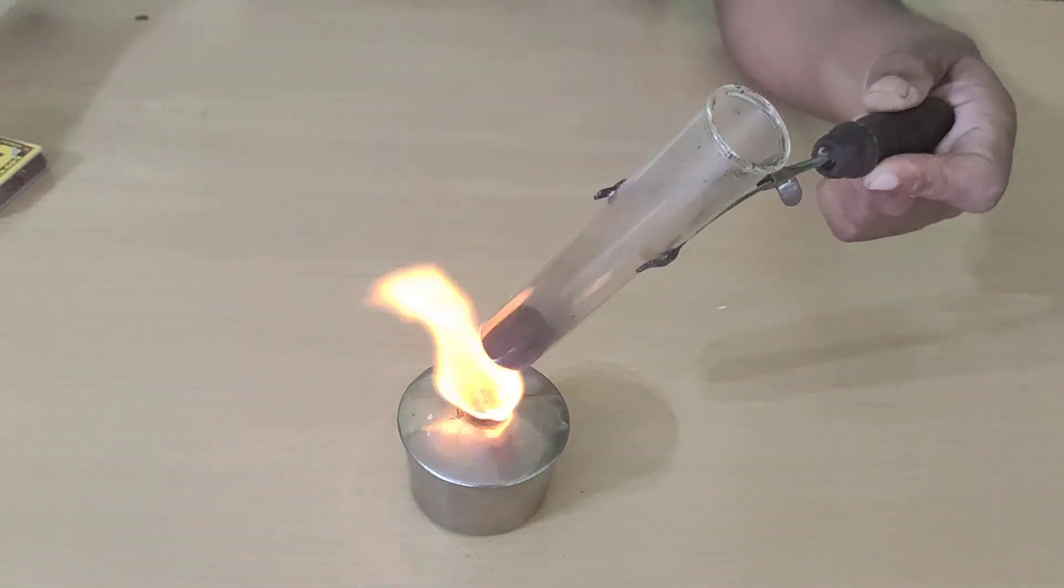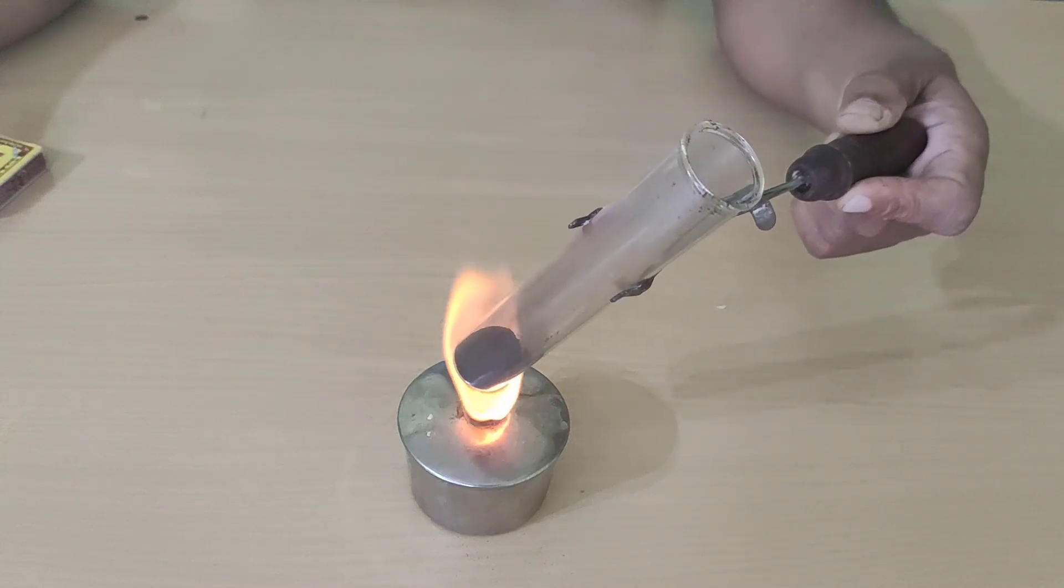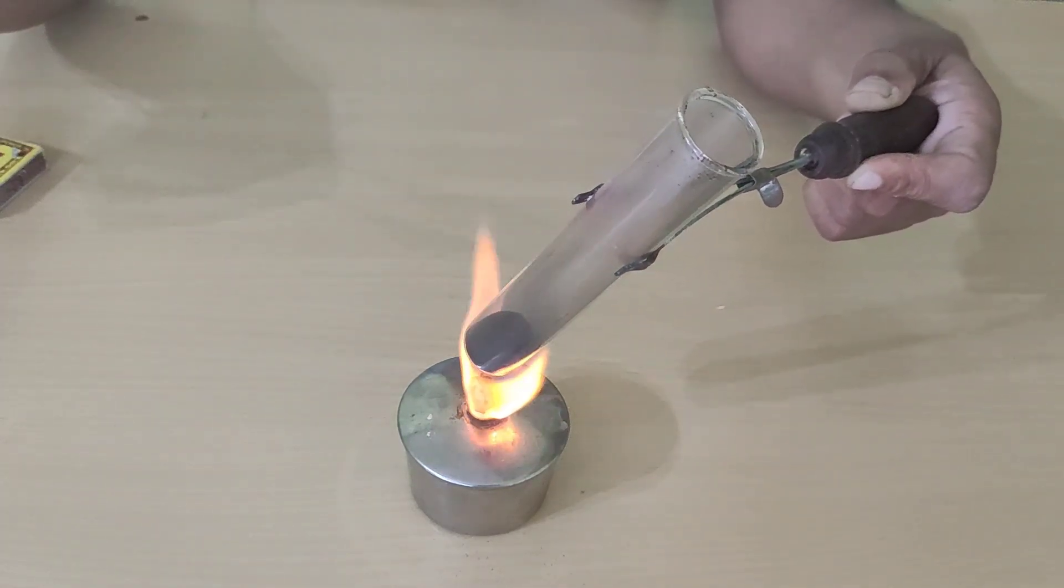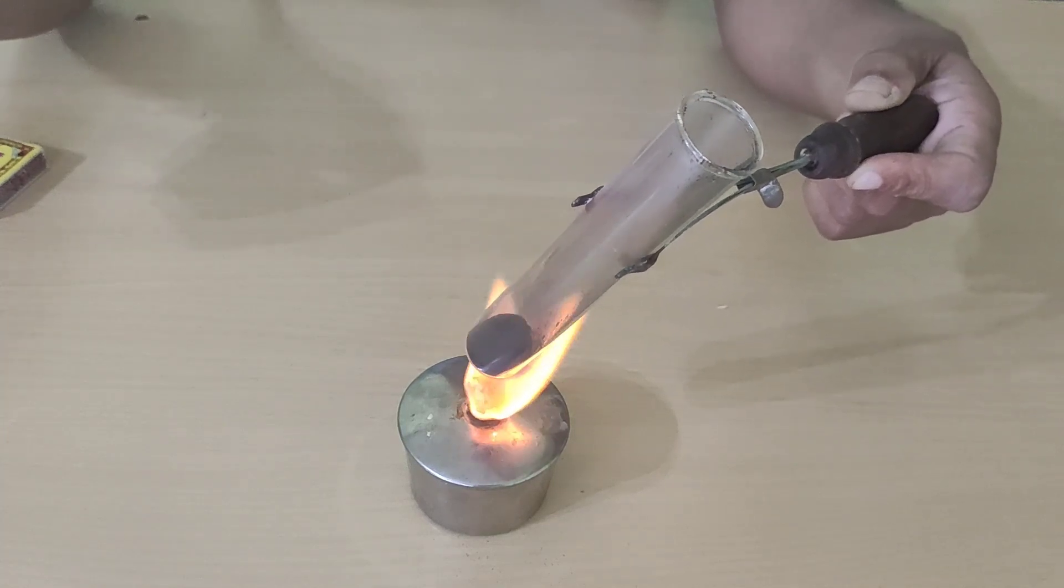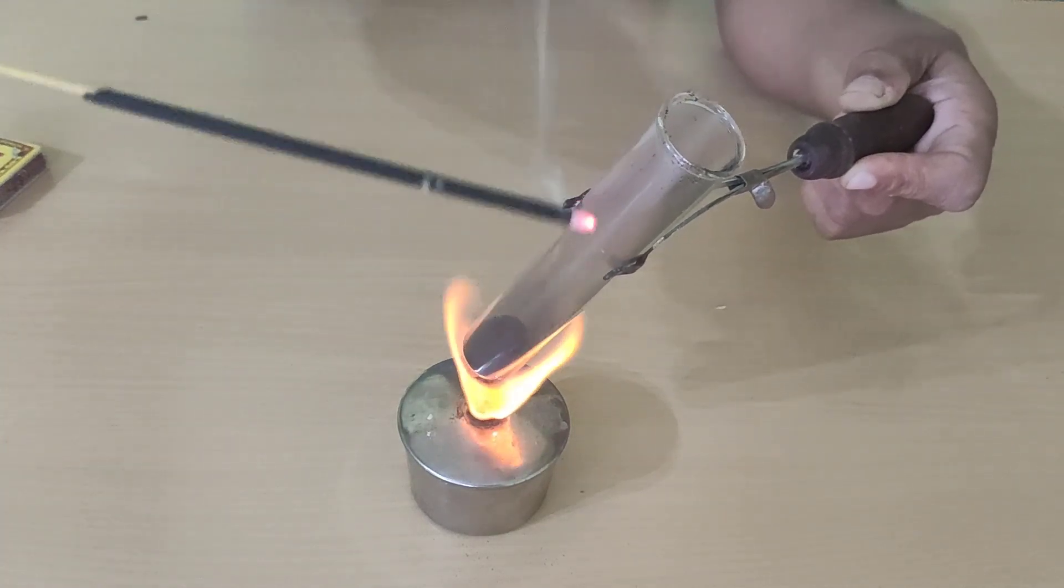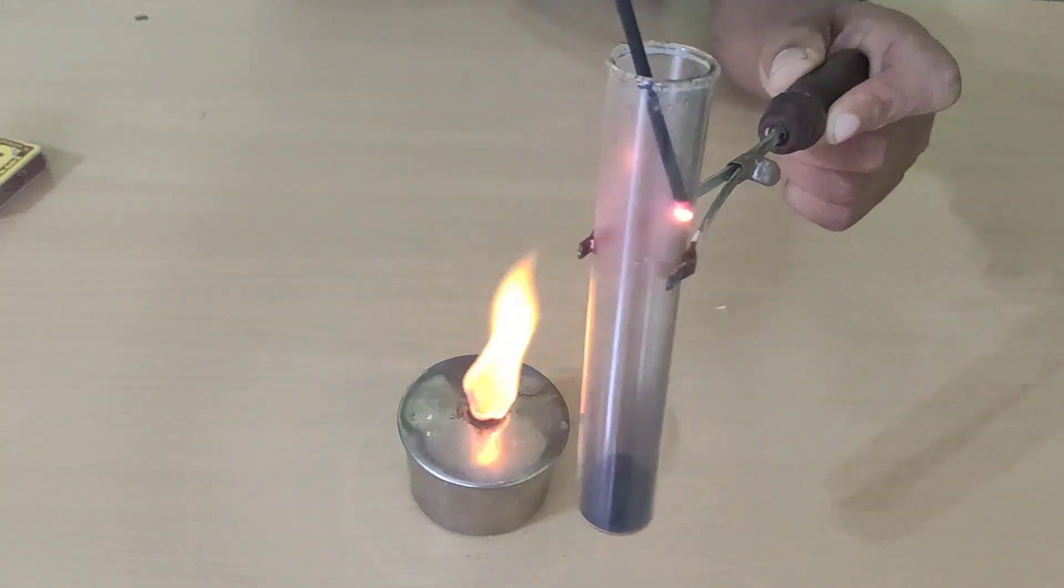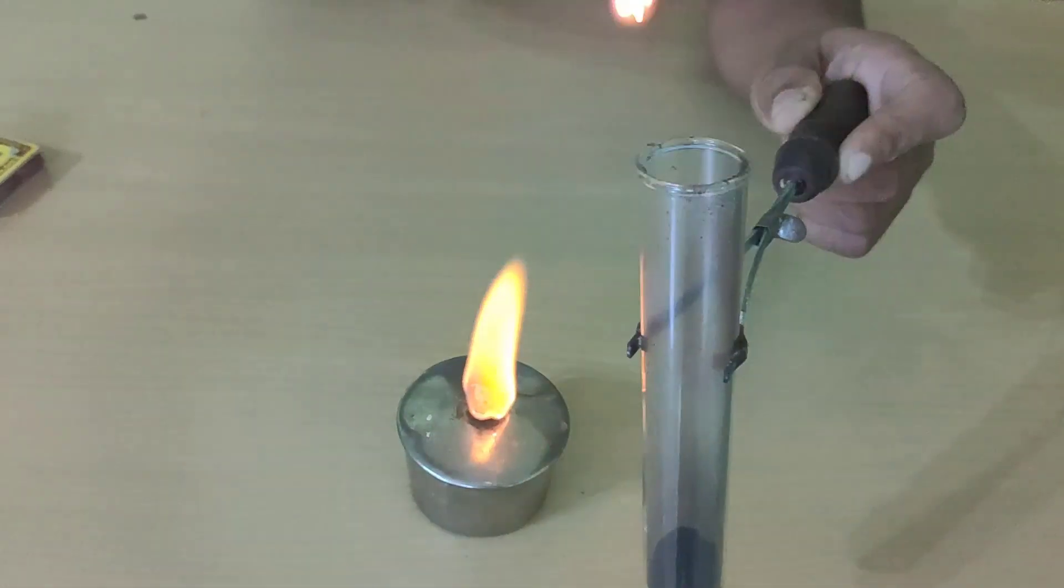And now, I will take a lighted incense stick and slowly put it in this test tube. See what happens. See, it is lighted.